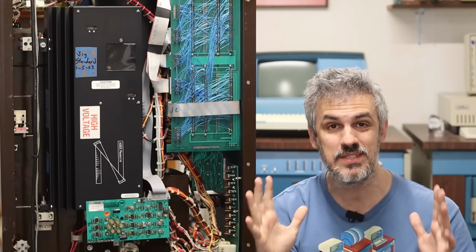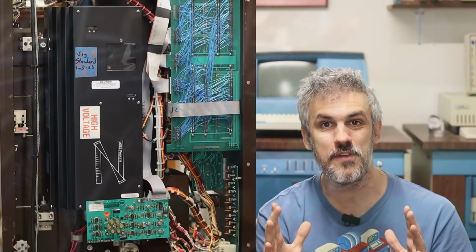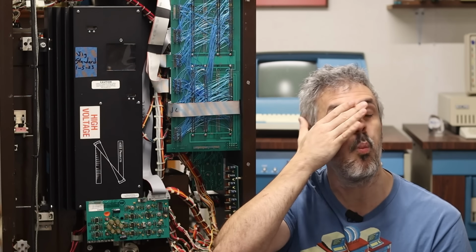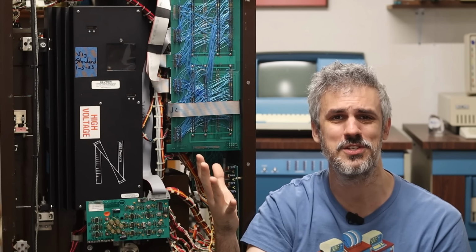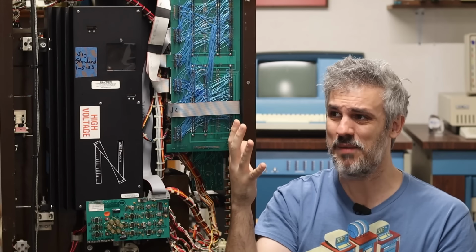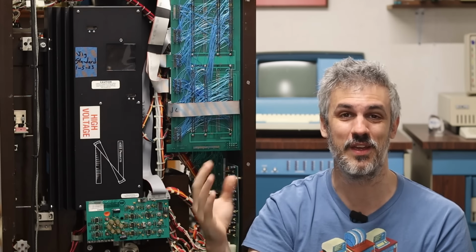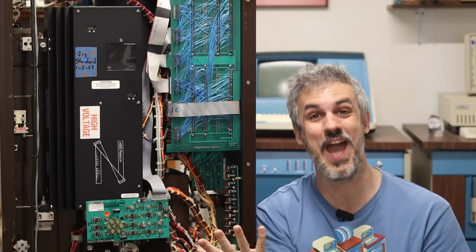I'm crazy confused. All I really got to do is make a connection from those 3 pins to the 3 traces that they're supposed to be connected to, and that should repair this backplane, but what a wild situation to end up in. I'm 90% certain that we found a production mistake on this thing, which is kind of a cool thing. All right, I'm going to try and come up with a game plan about how best to fix this, and then hopefully it'll start working again.